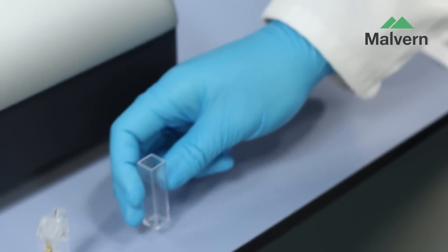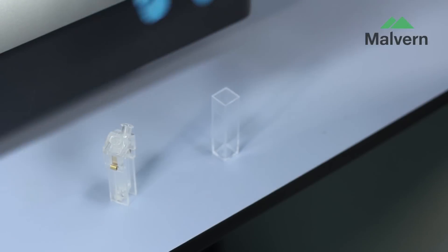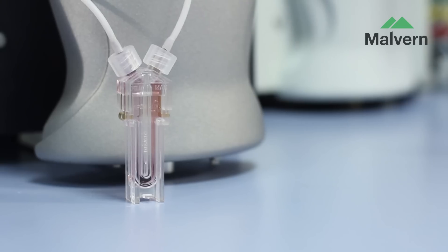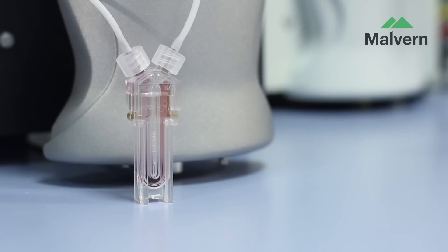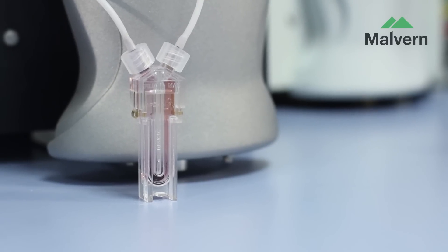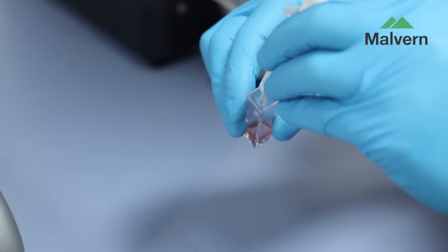Size measurements are performed in disposable plastic cuvettes such as this one. However, zeta potential measurements are more commonly made in disposable folded capillary cells like this.